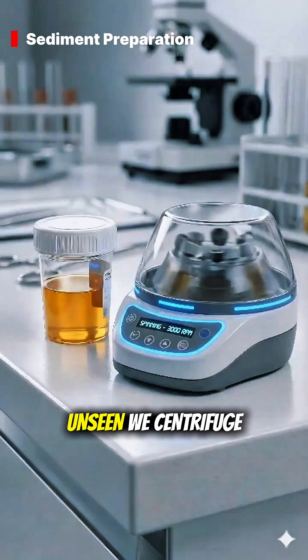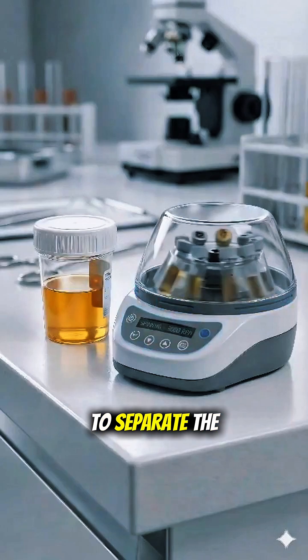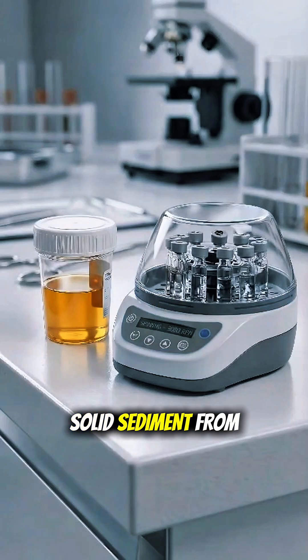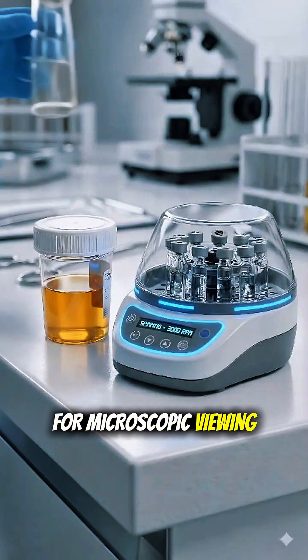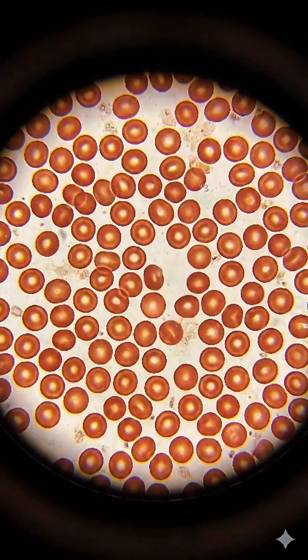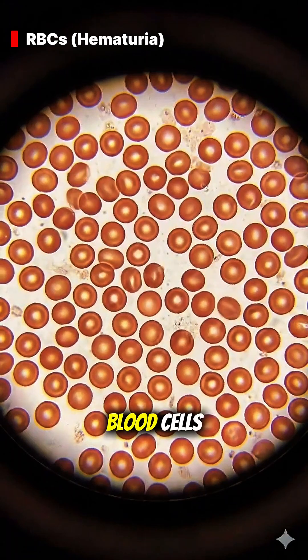To see the unseen, we centrifuge the sample to separate the solid sediment from the liquid for microscopic viewing. Under the microscope, these are red blood cells.